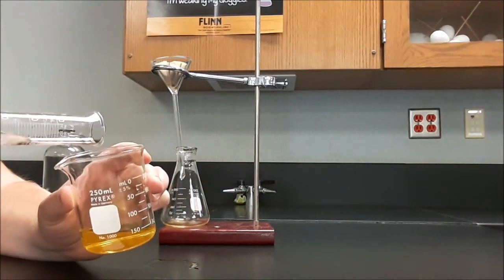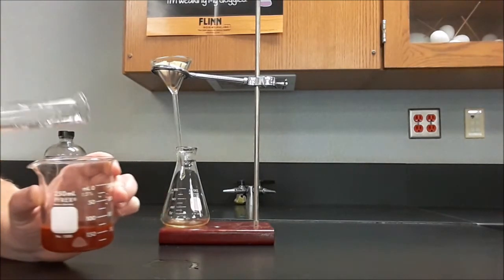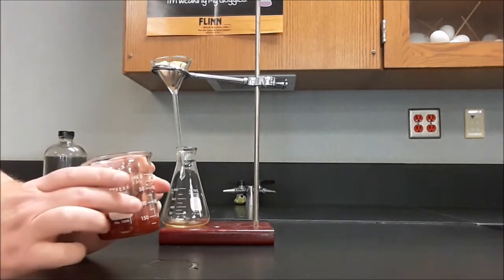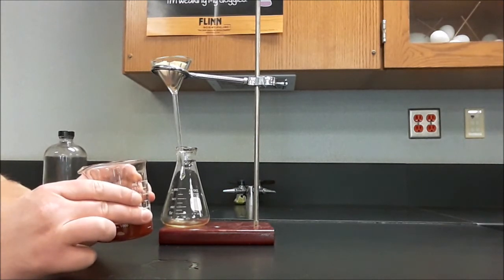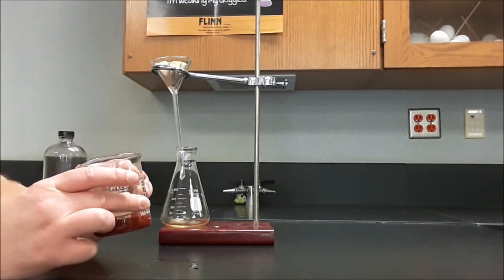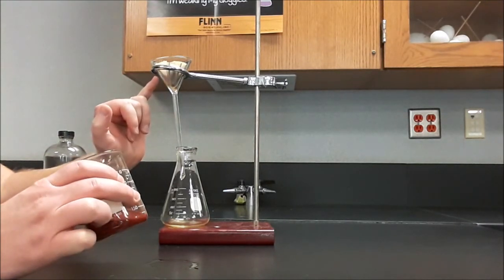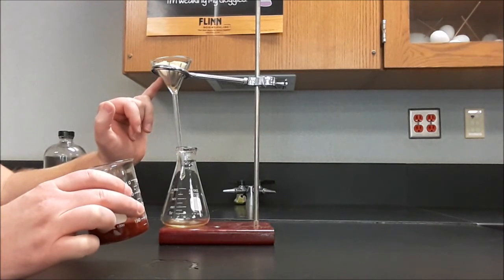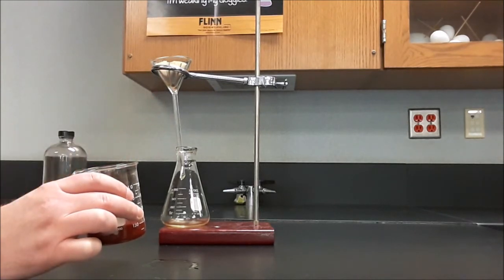So I'll mix these together. And that makes a precipitate. And I will need to filter this precipitate. The question is, should I use the piece of filter paper that's already in there, or should I go back for a second piece? The pores of this filter paper are pretty clogged by the precipitate from the first reaction. If I try to reuse this, all of the precipitate will be in the same place, but it might take significantly longer for the filtrate to make it through the filter paper this time.